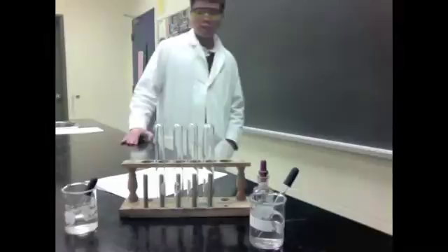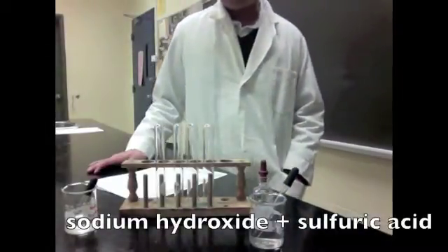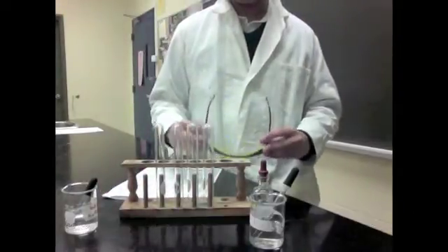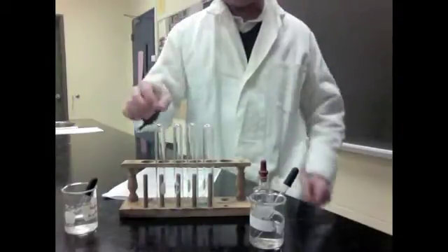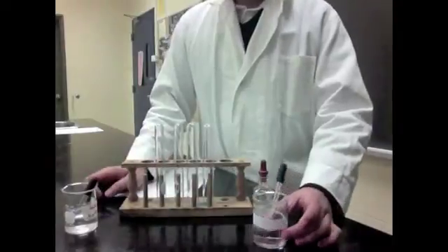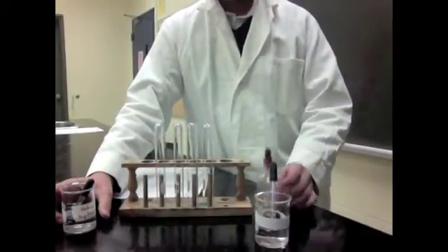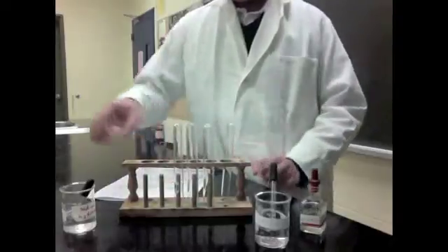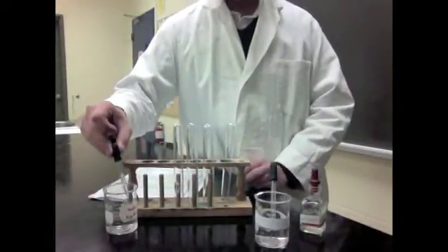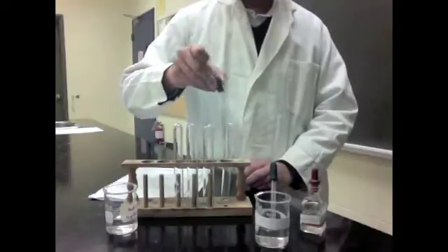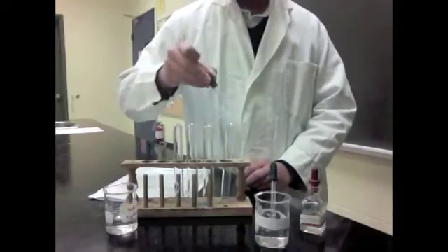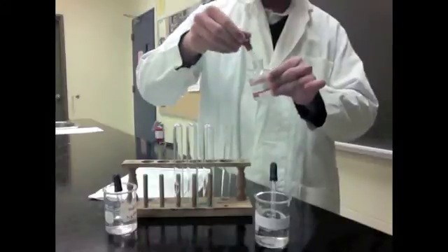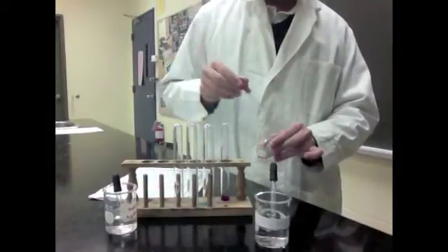Hi, my name is James, and today we're going to be doing the sodium hydroxide and sulfuric acid experiment. When you come to the station, you have to make sure that you are wearing your safety goggles, as these two solutions are very corrosive. You will need test tubes, sulfuric acid, sodium hydroxide, and phenolphthalein. First off, take a test tube and put two eyedroppers full of sodium hydroxide into it. Next, you will have to take some phenolphthalein, an indicator, into the sodium hydroxide. Notice the effects of the phenolphthalein.